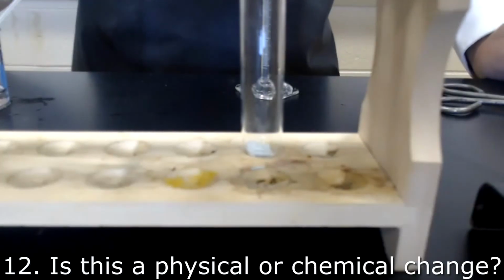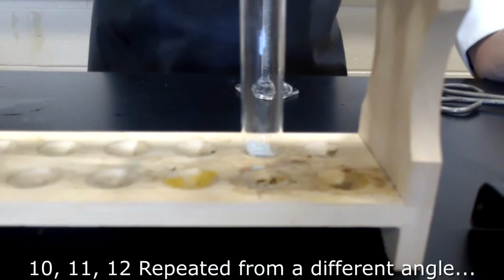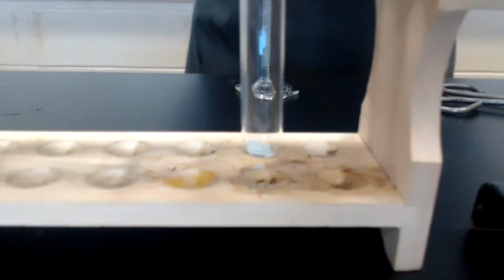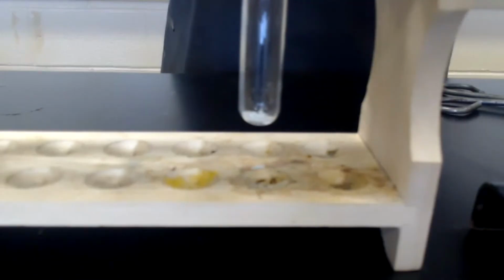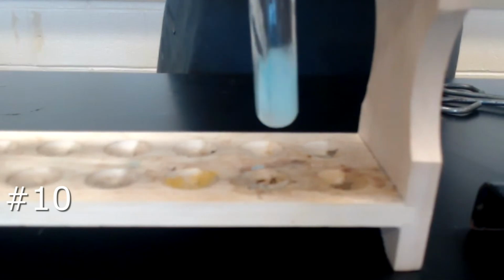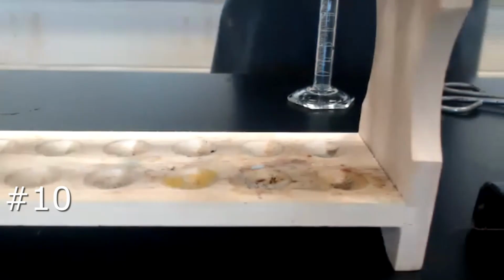I'm now going to repeat this process by first transferring the copper sulfate anhydrous, so without water, the anhydrous powder to a test tube. This will allow you to see the changes more easily. So I have my dried sample. I'm going to first add water, just as I did in the crucible. Going to mix this up so all of our powder dissolves.